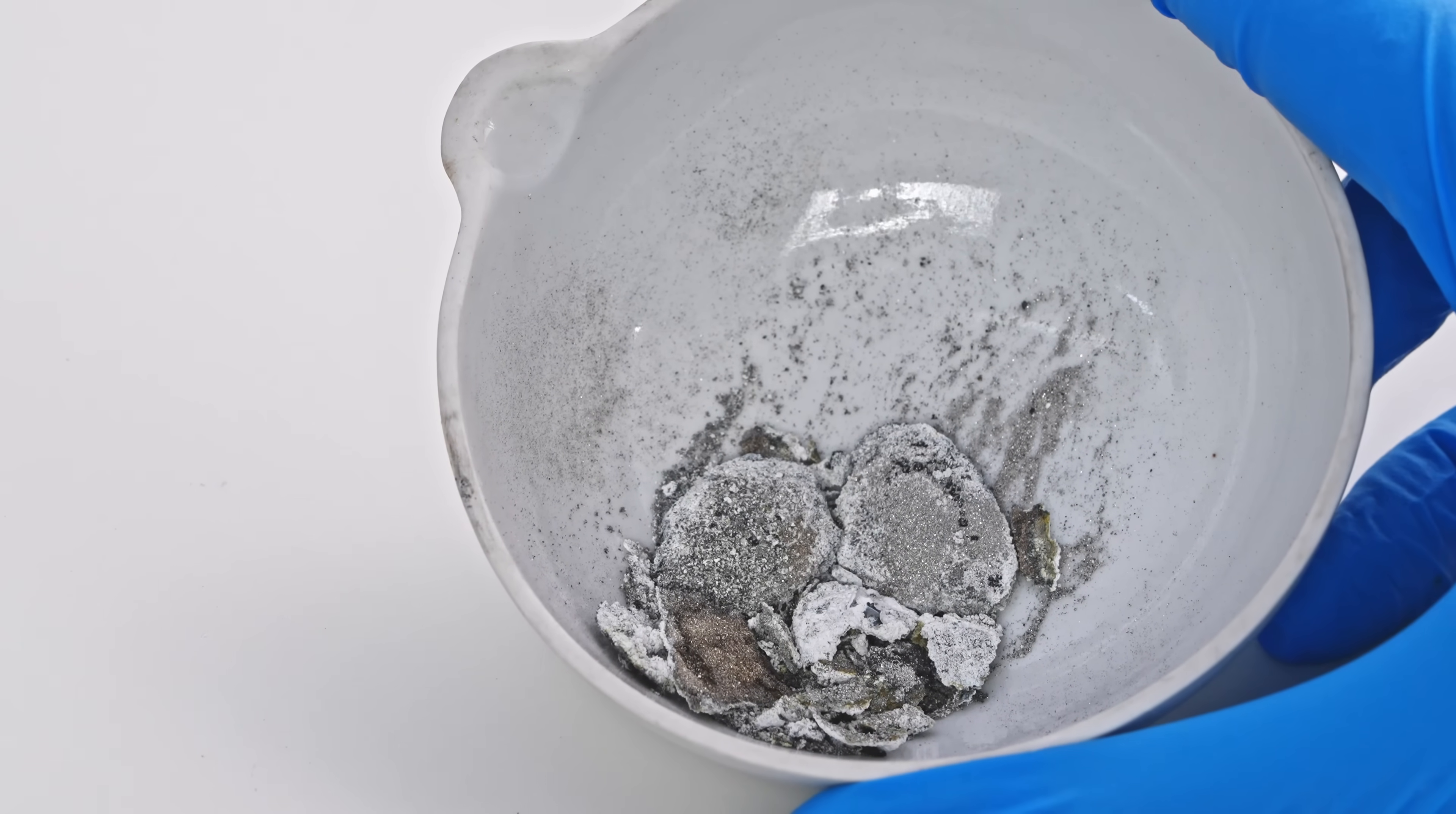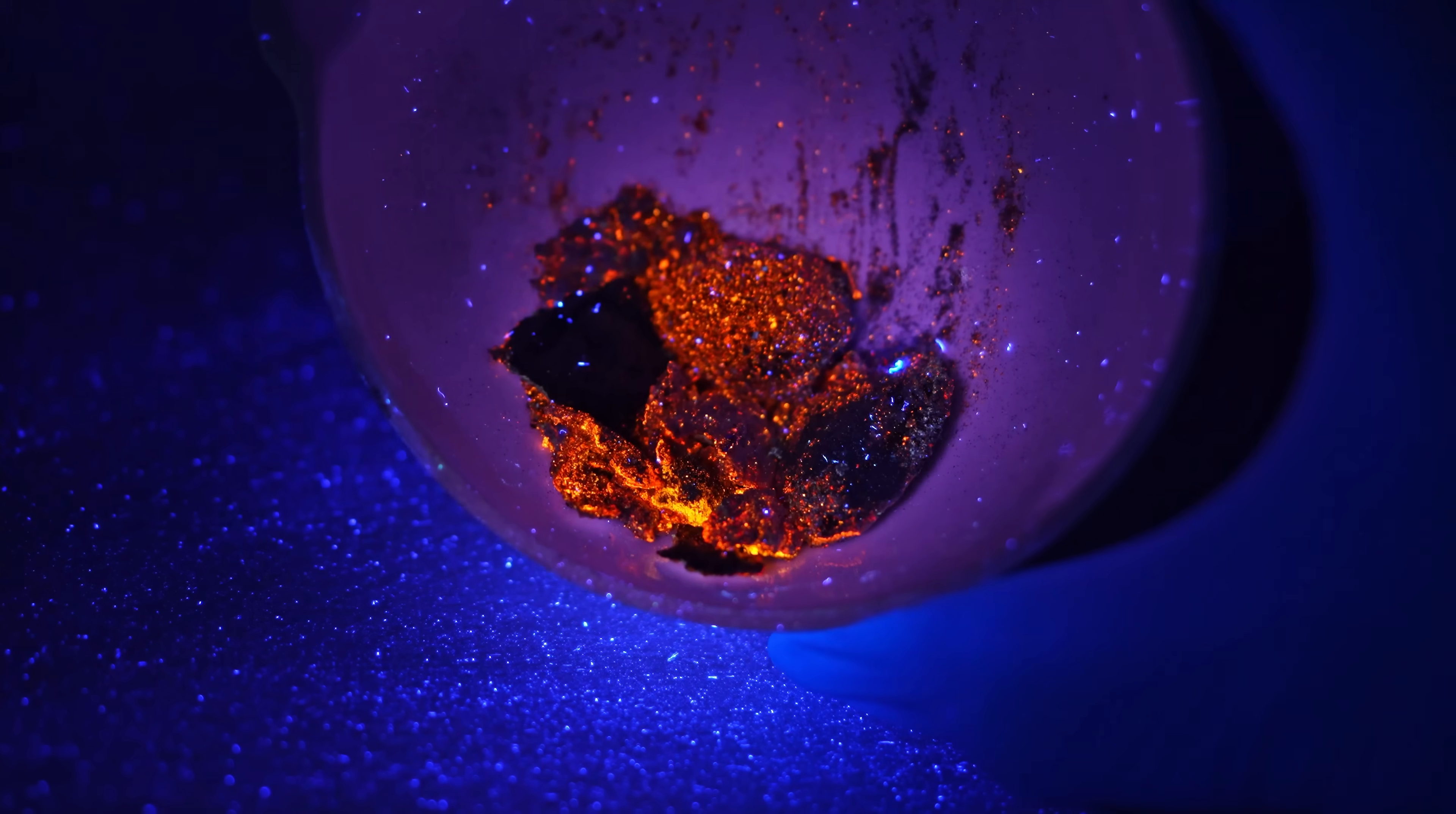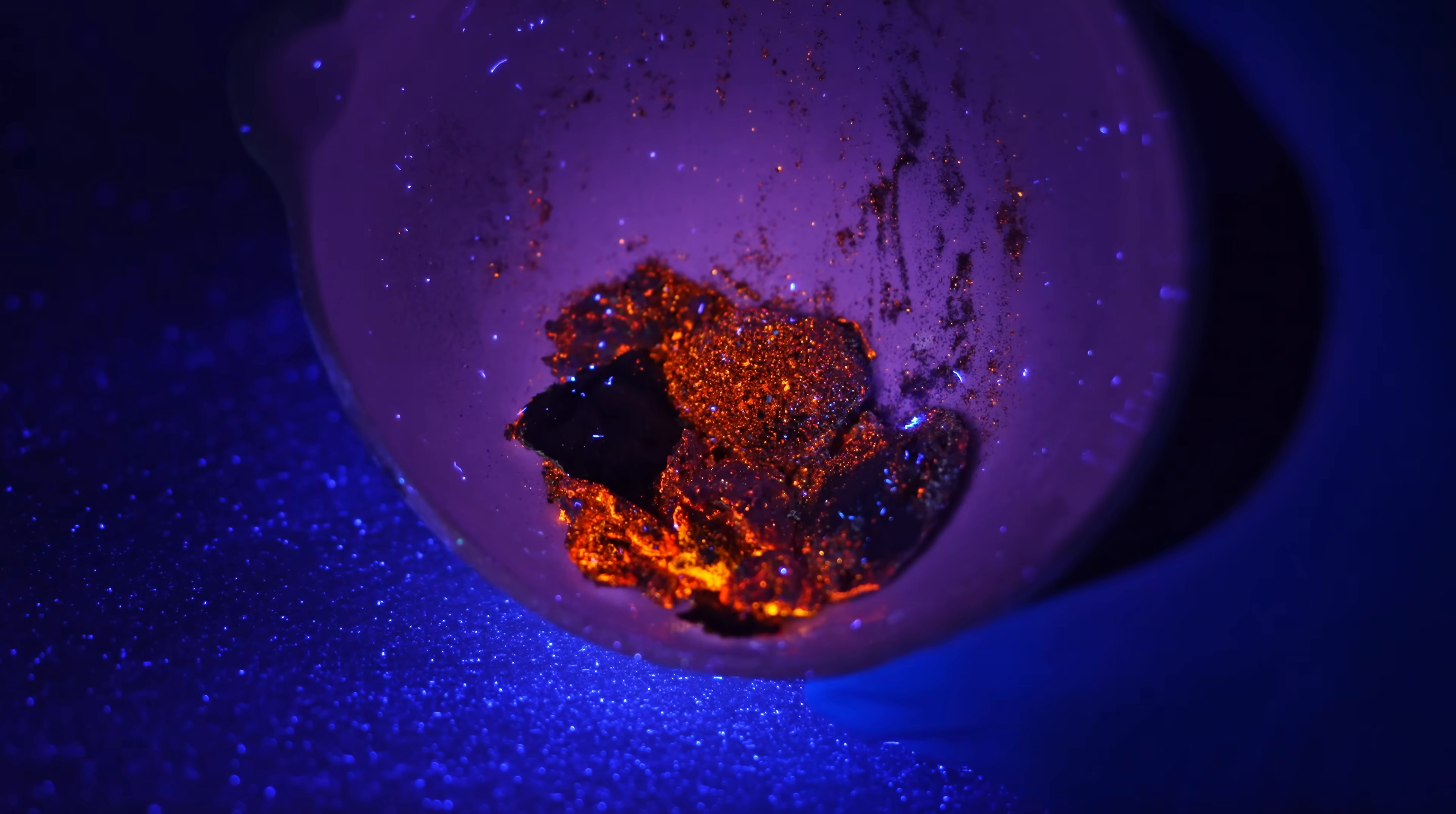Now, let's see how burnt magnesium looks when we treated it with nitrogen from the sprayer. Yeah, this time we got a lot of orange magnesium nitride specks.